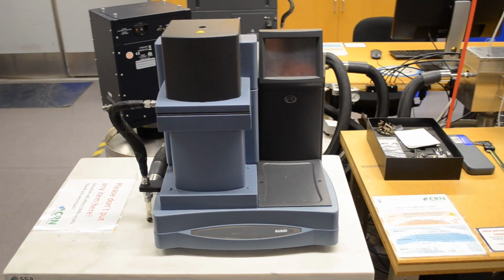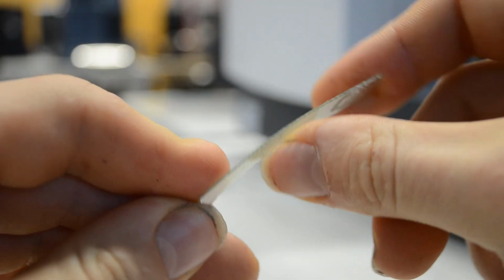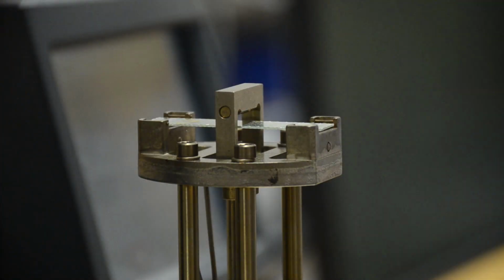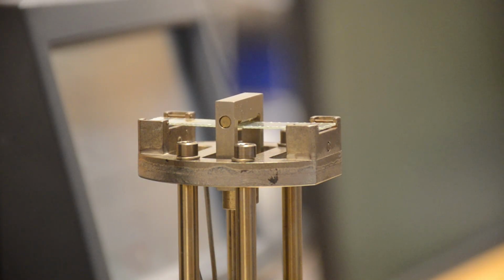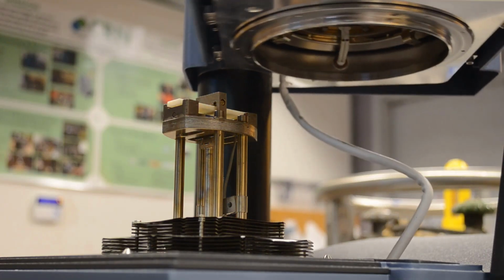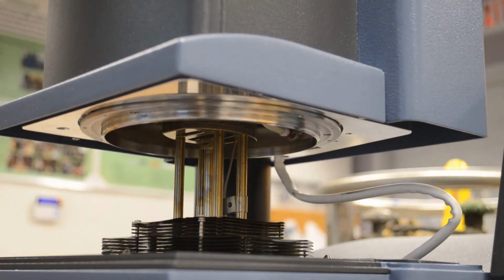In this video, we will explore some features, common uses, and operation of a dynamic mechanical analyzer, also known as a DMA. A DMA is an instrument that can apply forces to a small sample and measure the resulting displacements. These forces can be applied dynamically, for example with an amplitude following a sine wave pattern at different frequencies. DMAs also feature an environmental chamber to control the temperature of the sample and ambient humidity.